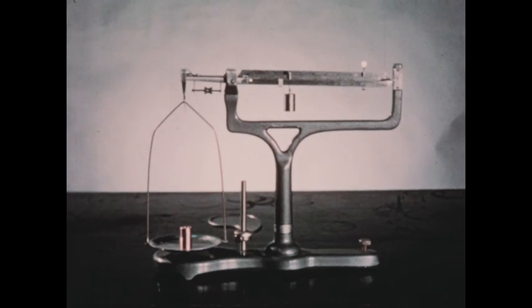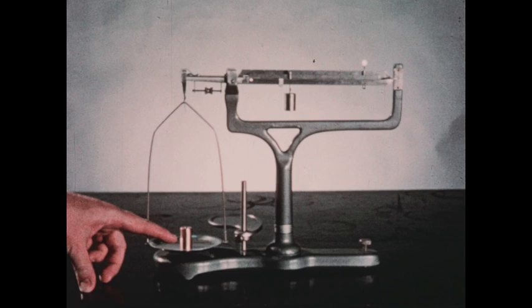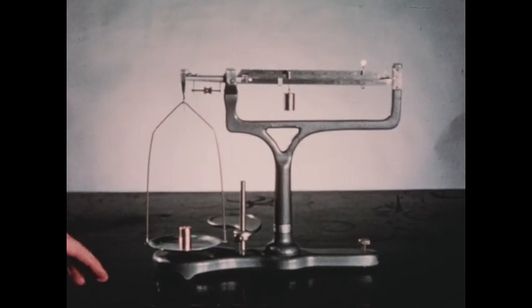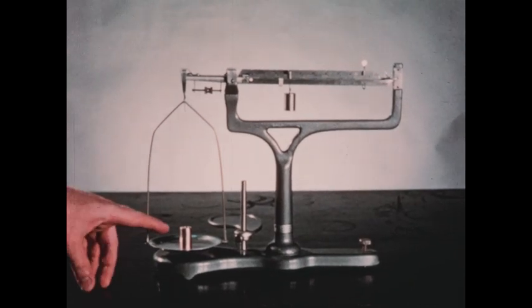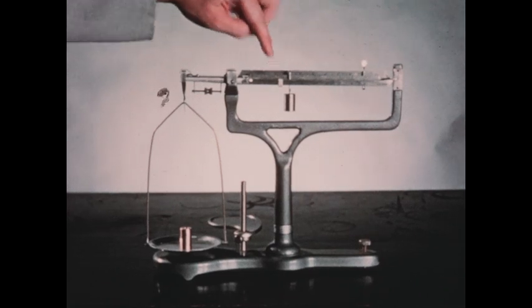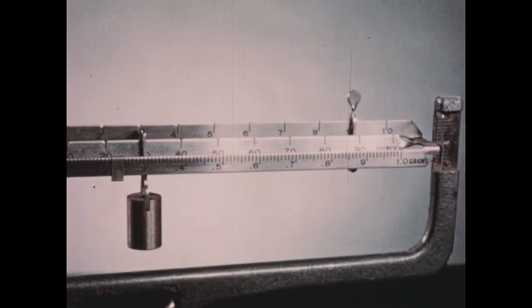specific heat of copper. I have a small block of copper metal here which has been placed on the pan of the balance. We're determining the weight of this piece of copper on a rather inaccurate balance, but great accuracy is not necessary at this stage of the proceedings because our determination of the approximate atomic weight of copper is just that, approximate, and great care in weighing would be a waste of time. So the weight of this piece of copper has rather rapidly been found to be 39.2 grams. This weight should be recorded because it will be used later.